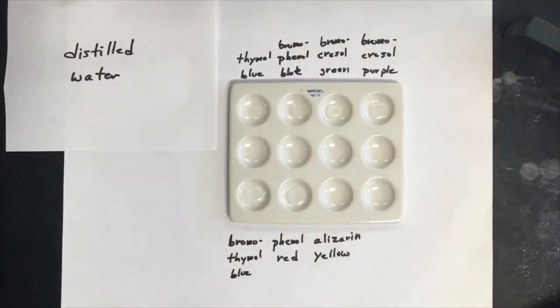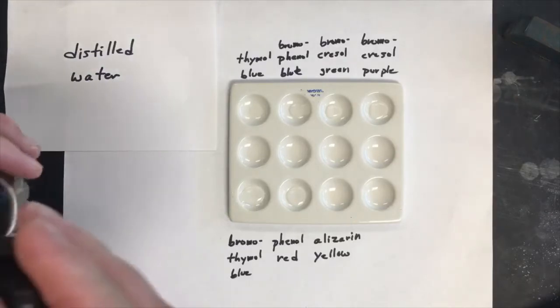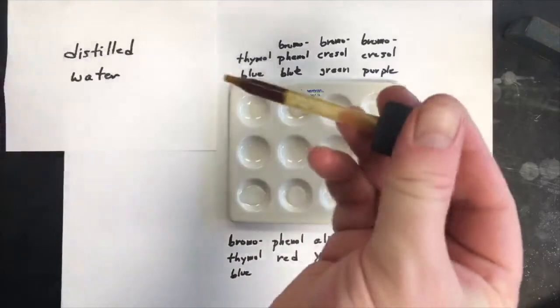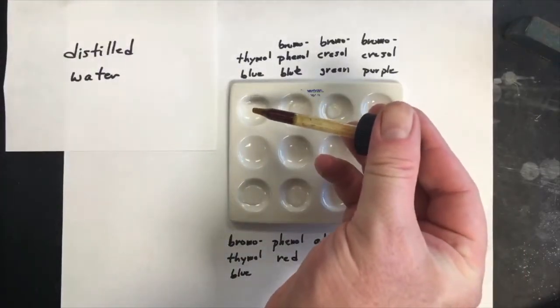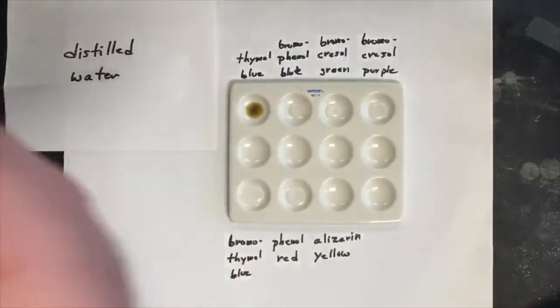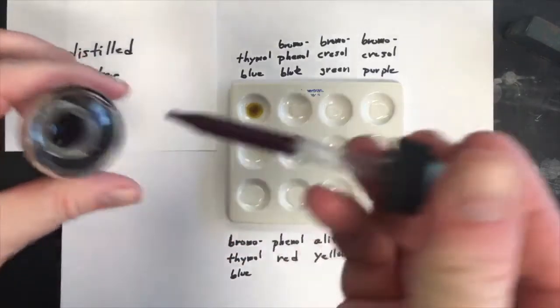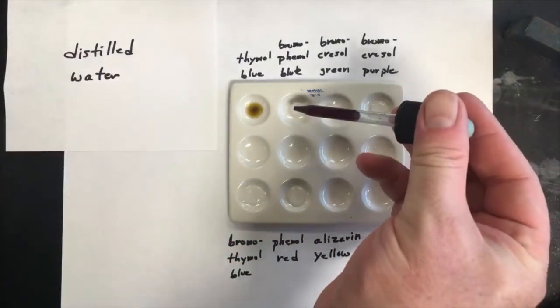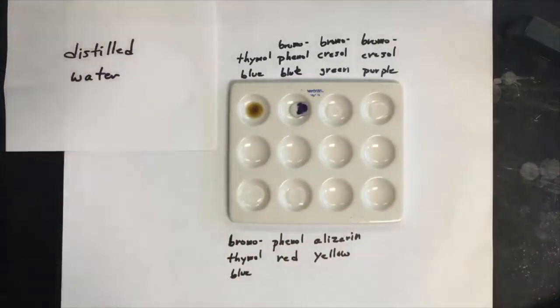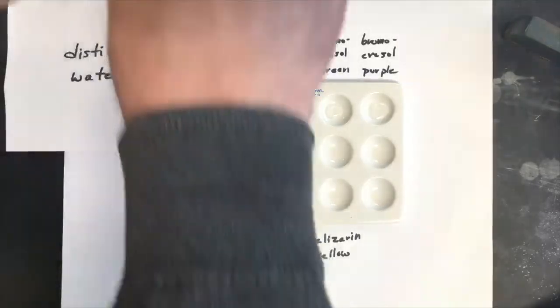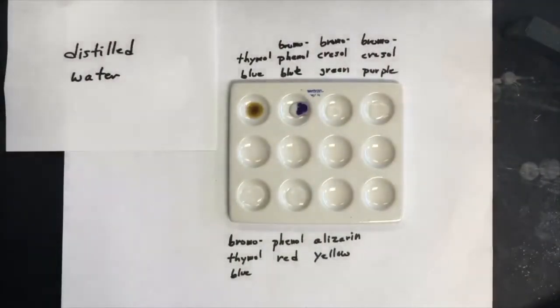And then I'm going to put one drop of each indicator in the well or I'll try. So that's thymol blue. And then we got bromophenol blue.